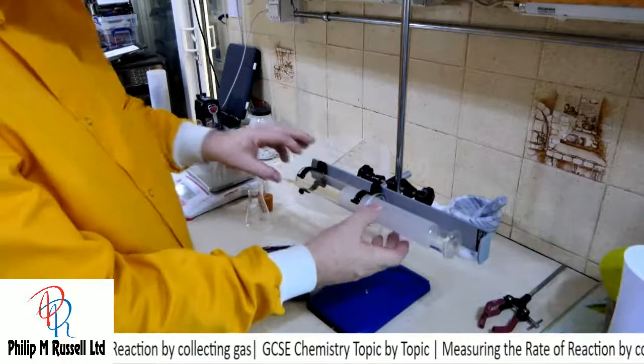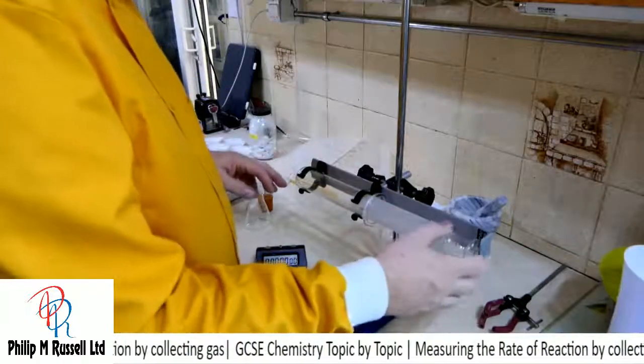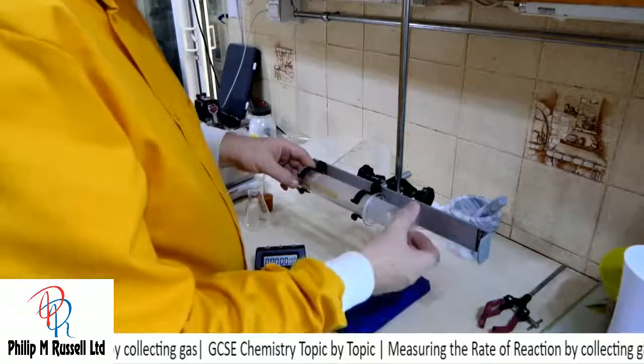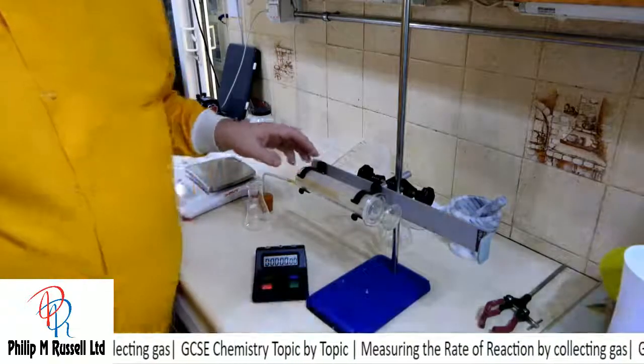That is 100, and it's got a little holder here, a little stop, so that if it goes too far it won't fall out.